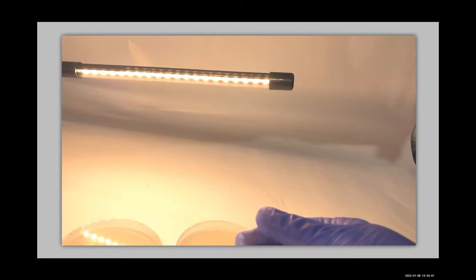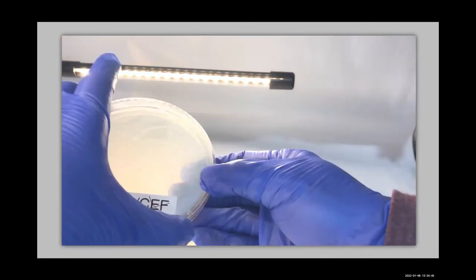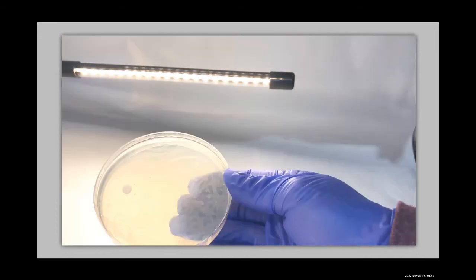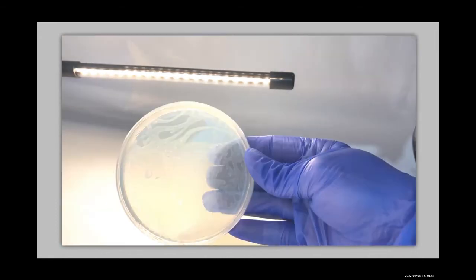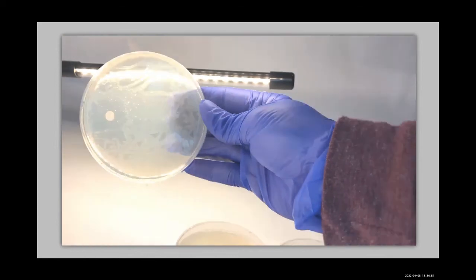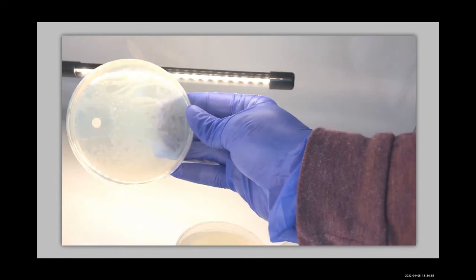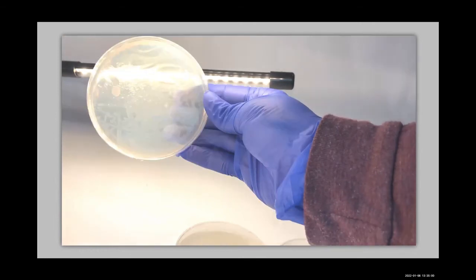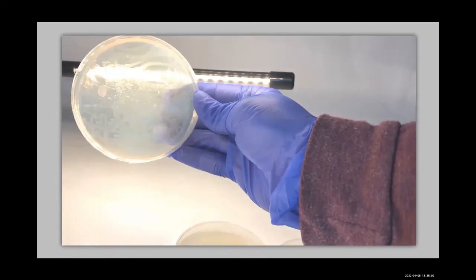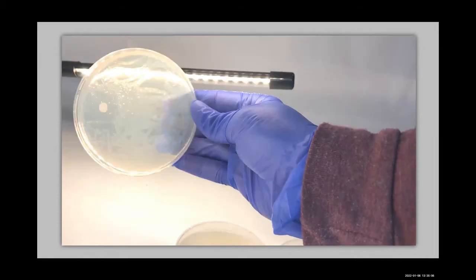2. This is E. coli exposed to clindamycin. You can see we fixed the labeling issue we had before because I had all my little bottles in the wrong place when I was filming. All right, here we go again, clindamycin. We're looking for a clearing. Do you see a clearing? I see a clearing right there around that antibiotic disc. Maybe not quite as obvious as the last one, but it's there.